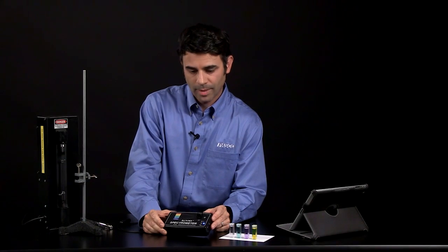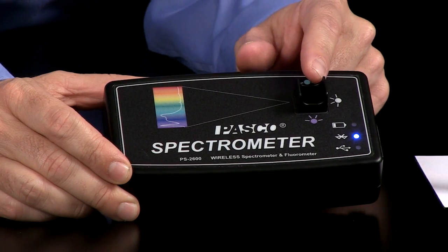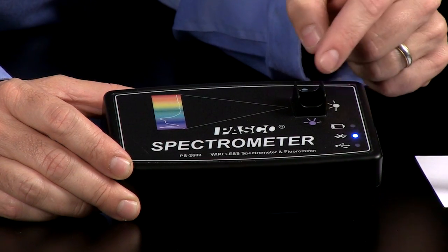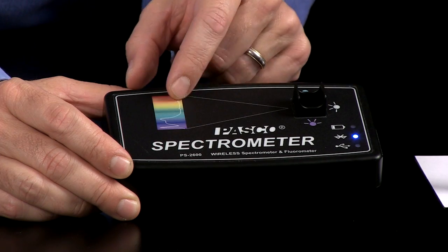This is a visible spectrometer. You'll notice from the box that there's a cuvette holder. The labels indicate the light sources that can illuminate your sample. There's a label over here indicating where the detector is.